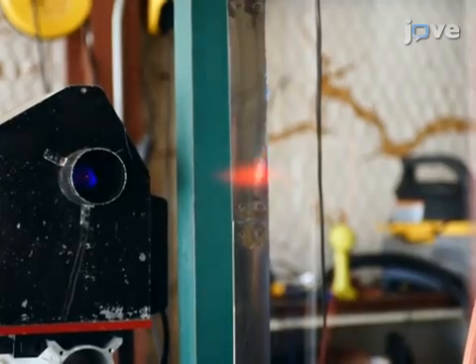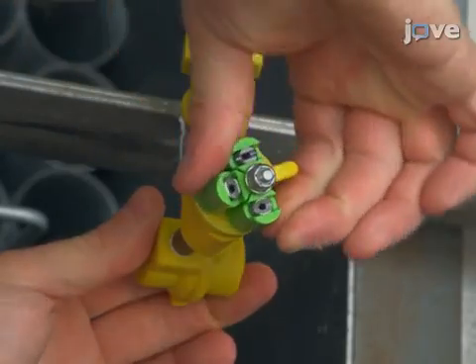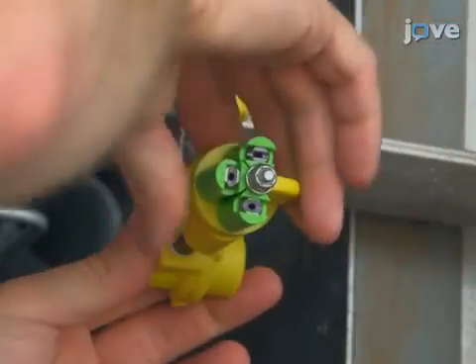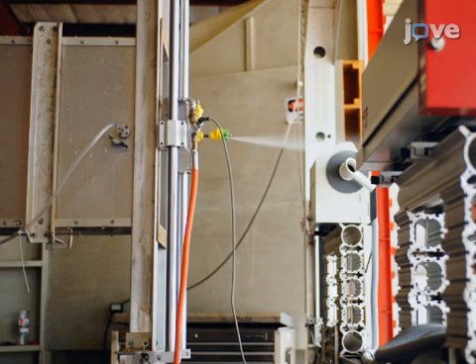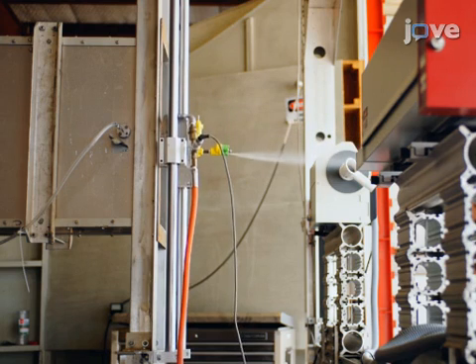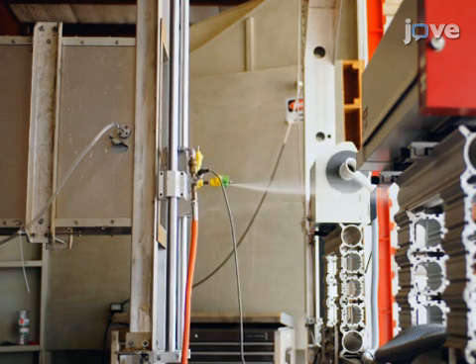After watching this video, you should have a good idea of how to evaluate ground and aerial nozzles under a wide range of operational conditions. Don't forget that working with lasers can be hazardous, and all proper safety precautions should be taken when working with this method.